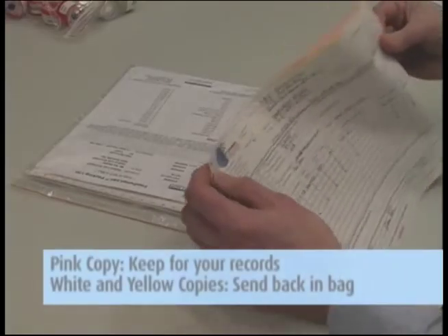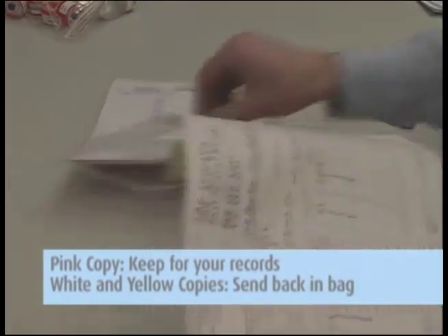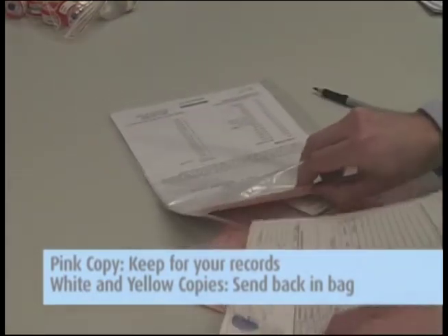Send the white and yellow copies in with the samples to the lab in the large ziplock bag.